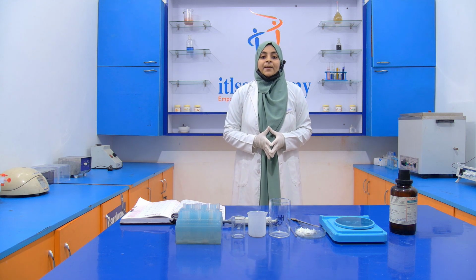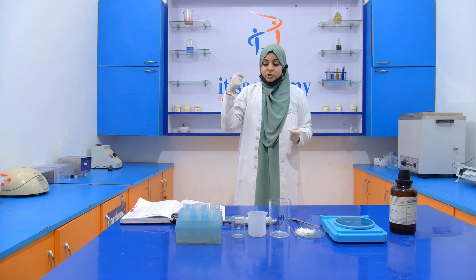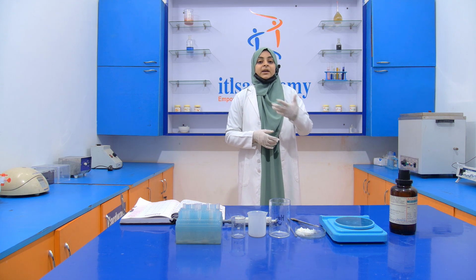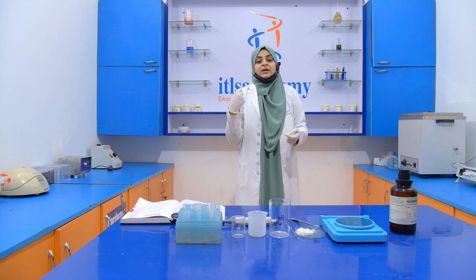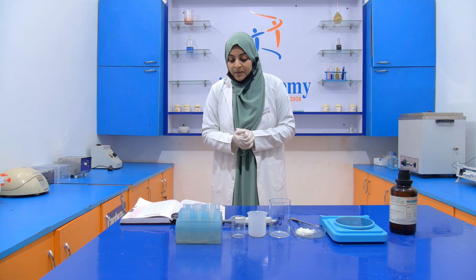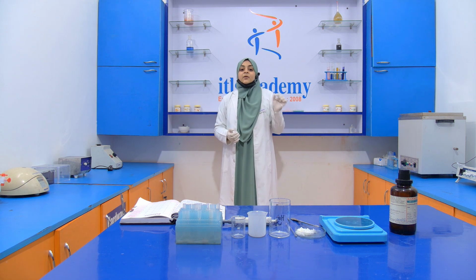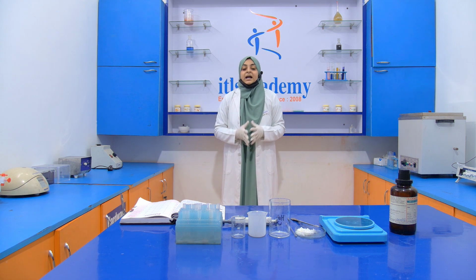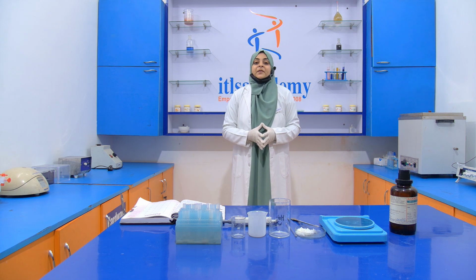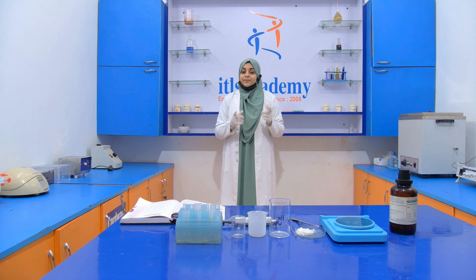Now what we have to do: we take 1 gram of sample into a beaker, then we add 3 ml of the concentrated HCl. Then we mix it with the help of the glass rod. After proper stirring, we remove that glass rod from the beaker and examine it. If any fine fibers are present on our glass rod, then it means that our sample is adulterated with blotting paper. If you don't get this, then it means that our sample is pure.